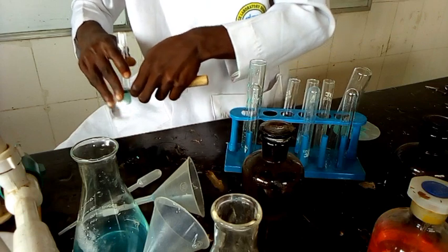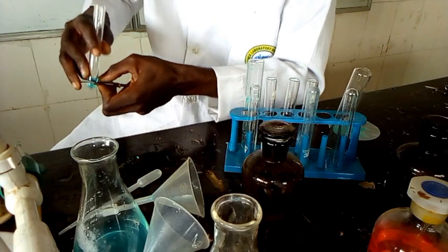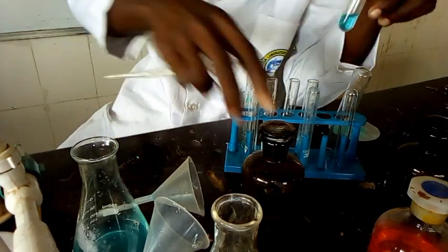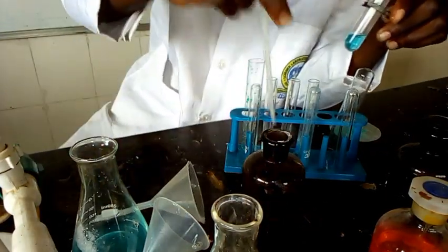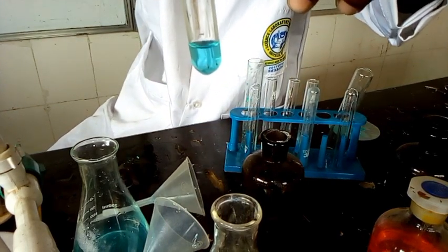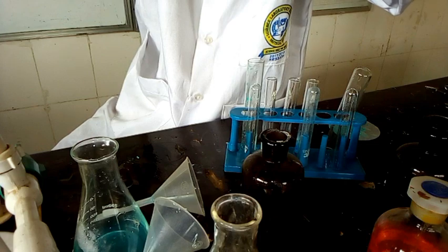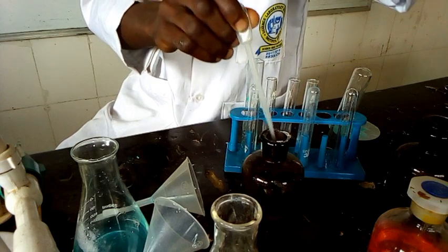Now let's move on to the second portion of the filtrate. To the second portion of the filtrate, we are told to add dilute NaOH and then warm. So when we add dilute NaOH to this, then we warm it up. This is dilute. Let's put it in drop. Wow, we have a blue gelatinous precipitate in drop. In excess, the blue gelatinous precipitate formed is thicker. That should be your observation.